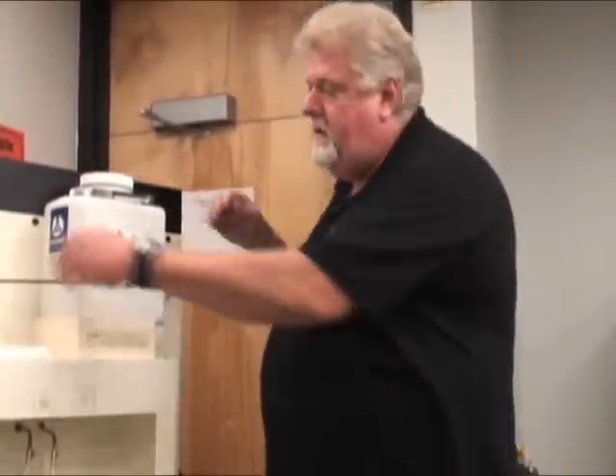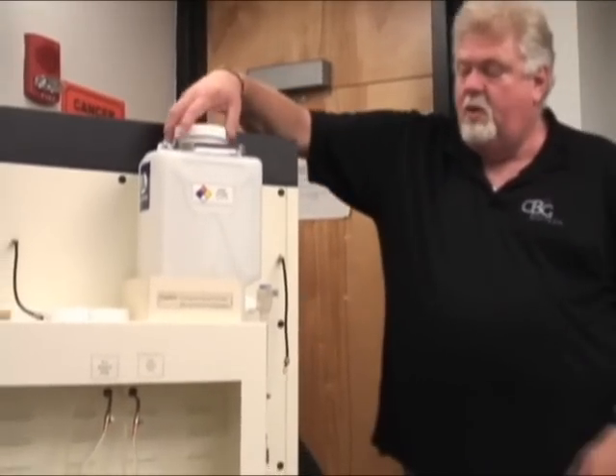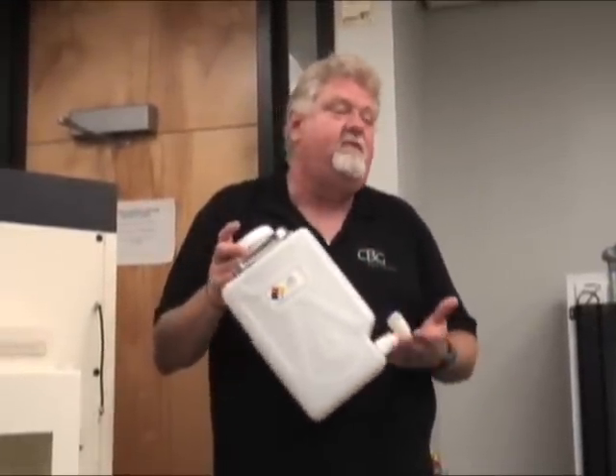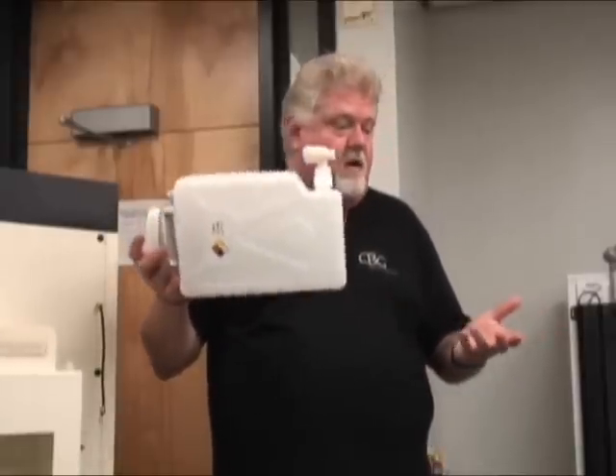Let's talk about alcohol next. We're going to take off the safety straps. Always make sure the spigot is closed for safety, because there's always a little bit at the bottom — that's the normal below-spigot amount. Don't tip it in the machine. It's graduated to be there; if you had a full run, you'd overfill the unit. Just leave it, close the spigot, and take the container off.